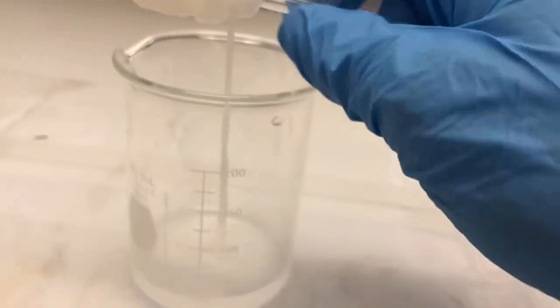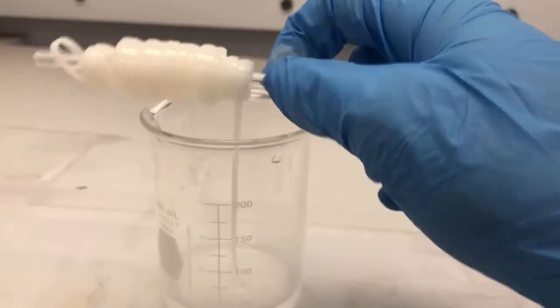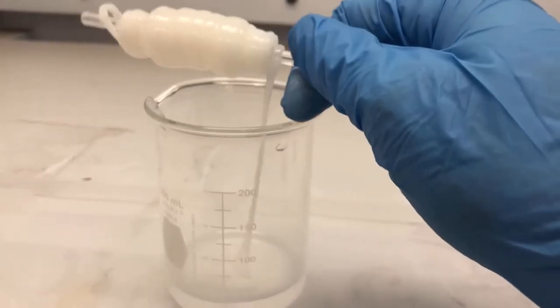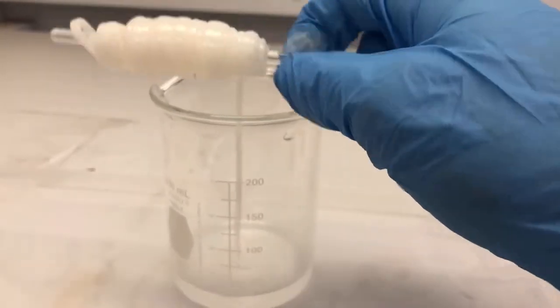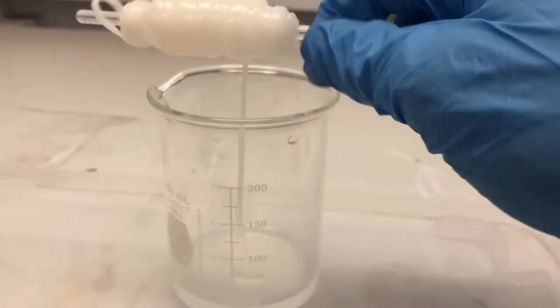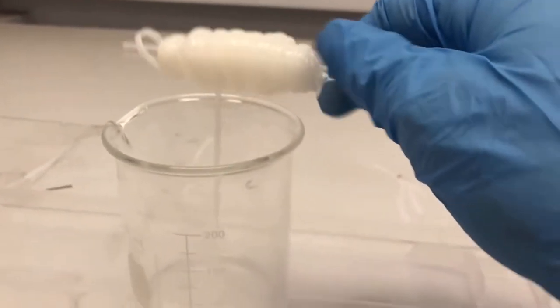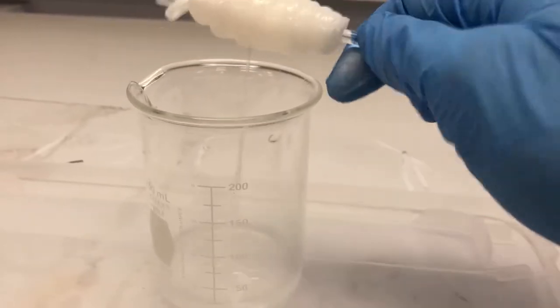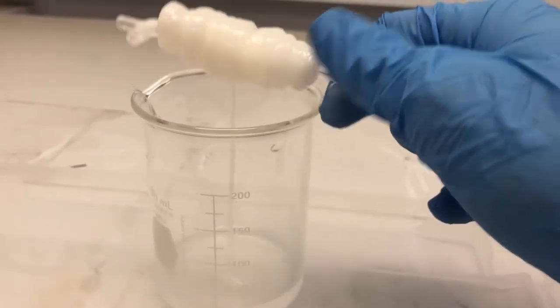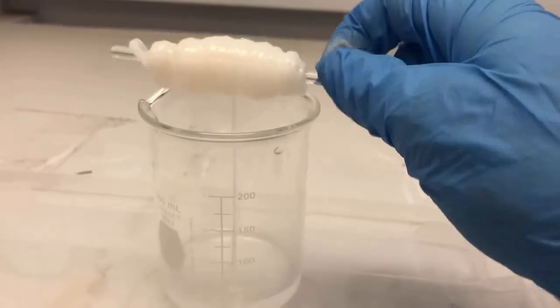But I love this polymerization, and it's so cool that we've talked a lot about the equilibrium constant K for our leaving groups, and now we see that in action. Actually seeing the difference from when I was a student, this never worked. You could never, in a million years, hope to grab as much of the polymer as I'm grabbing right now. But lo and behold, we're doing it.